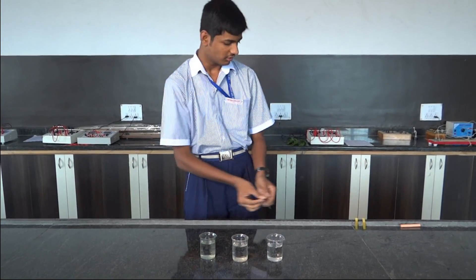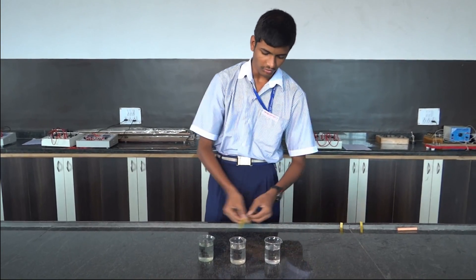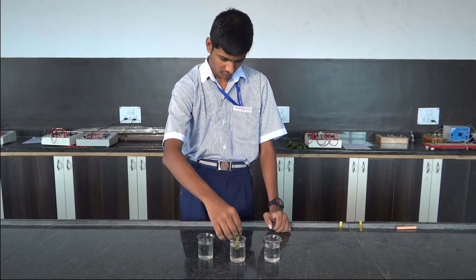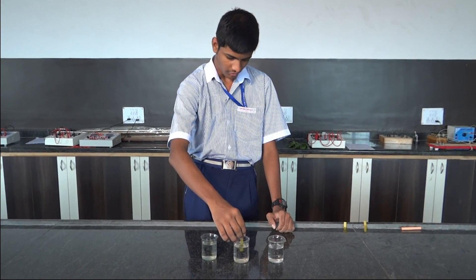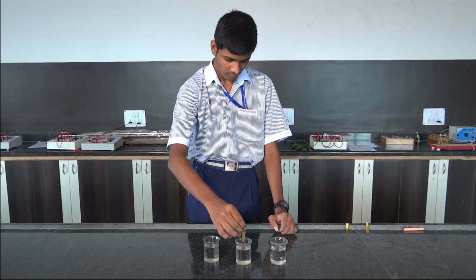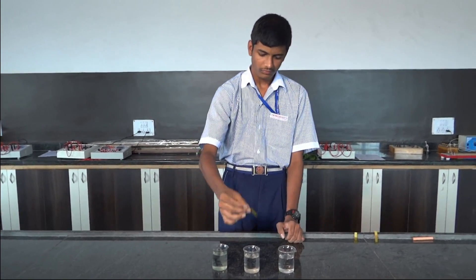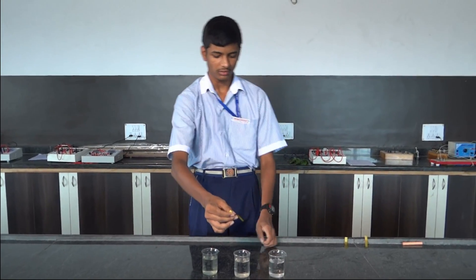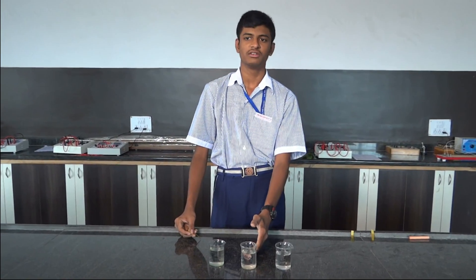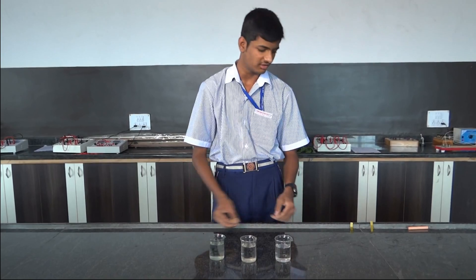Second, we will go through pond water. The pH value of pond water is 5.3, so it is acidic since it is less than 7.